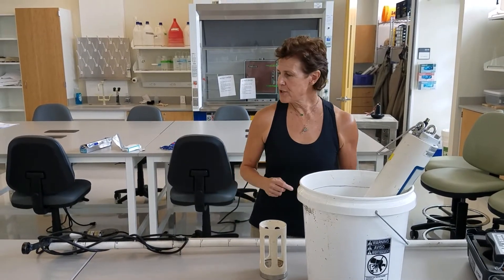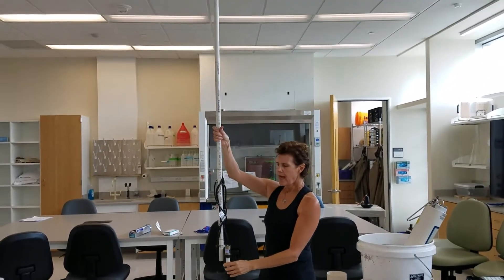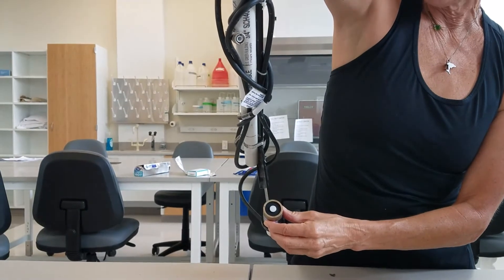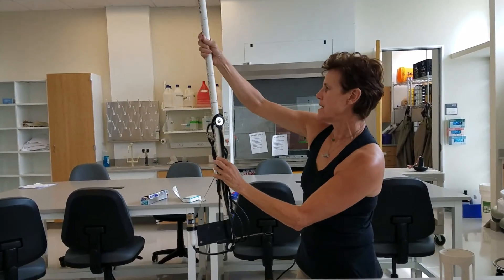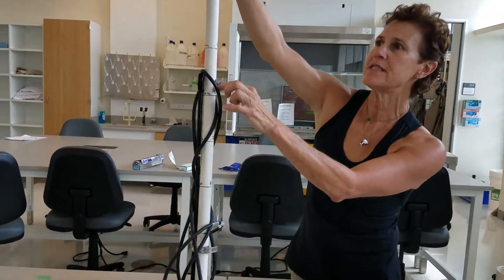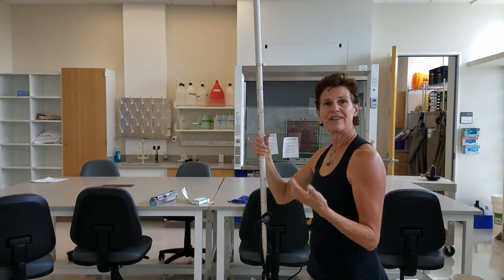So what we've got here is our light meter. It has a detector that allows us to determine the amount of photons essentially getting to that detector. This detector is actually lowered into the water. We start at the surface and then go down by 10-centimeter intervals, and the light that makes it to the detector decreases as we go down.